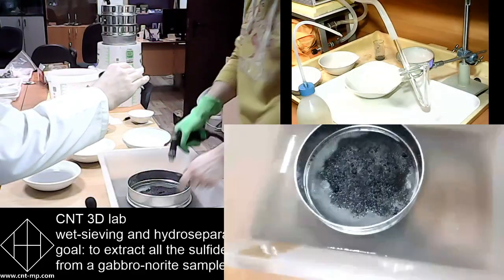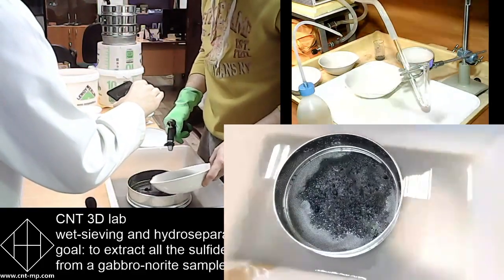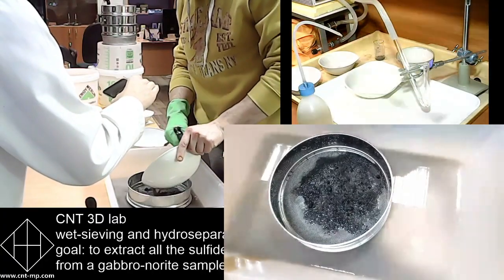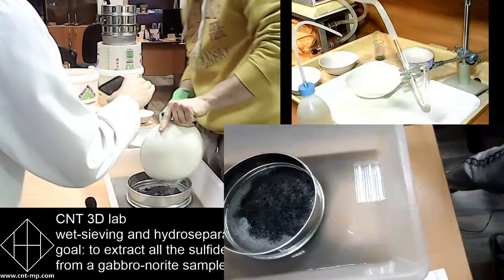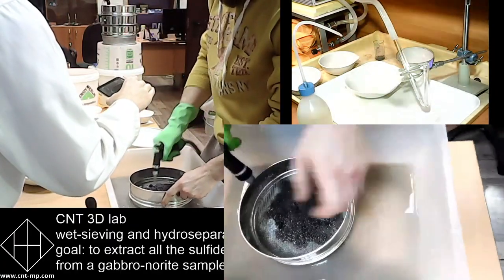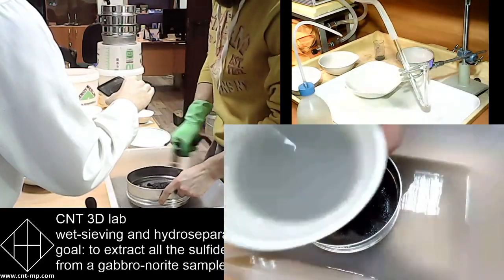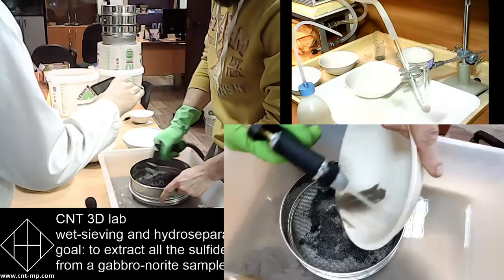First we process all the material after Spark 10 using 1 mm sieve. So we have +1 and -1. That has to be done the way that he does it. So basically, he pours pretty much everything in one sieve, 1 mm sieve. It's all done in a plastic tray, so no spills and nothing gets lost.